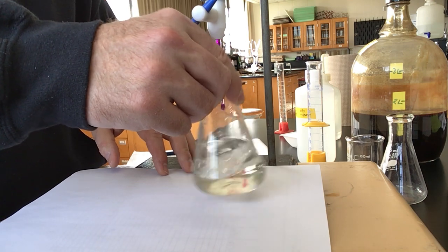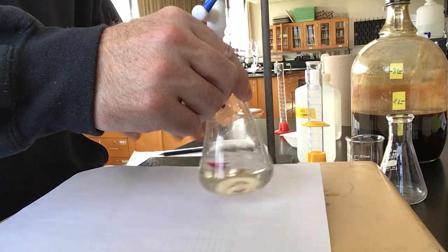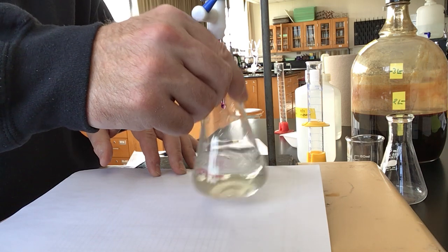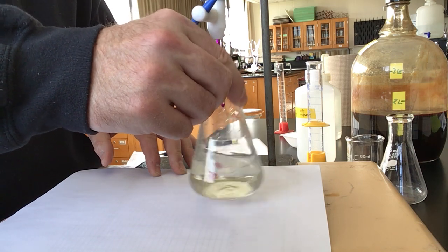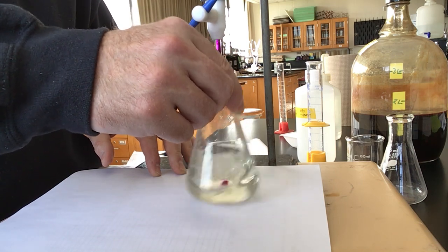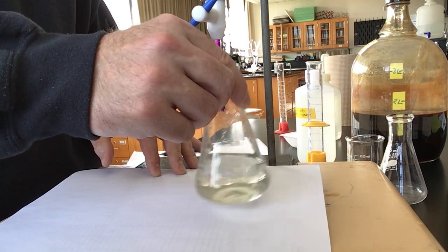Titrations, it's all about patience. And you can sometimes do a calculation to be able to figure out how much titrant that you're using.